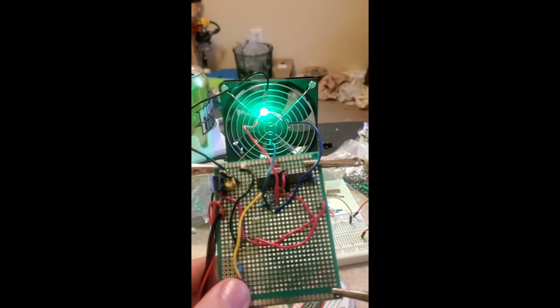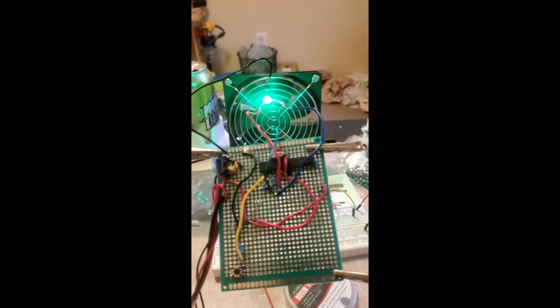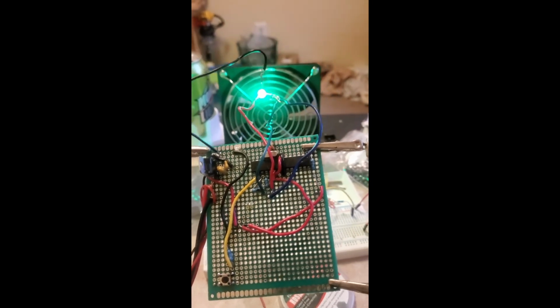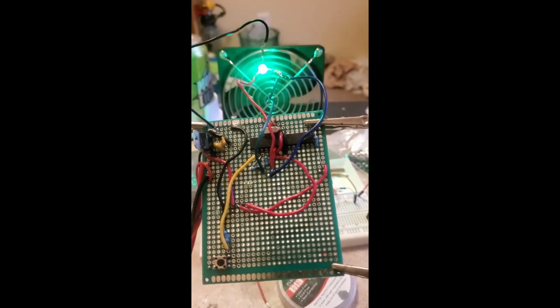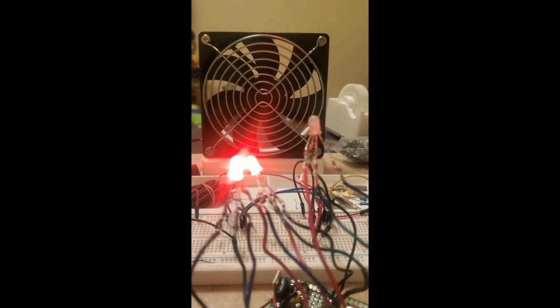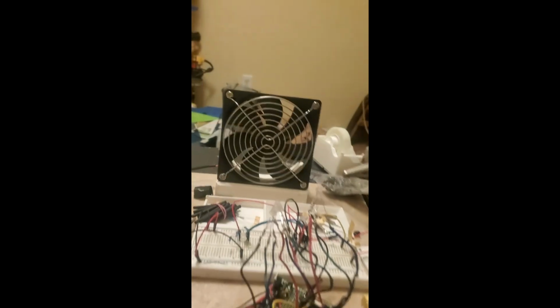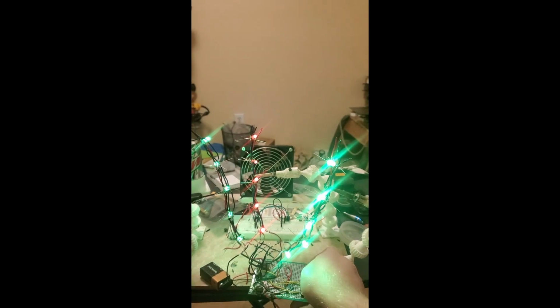So what can we add to a tube rack to make it officially over-engineered? Well, first thought that always comes to my mind is color-changing LEDs. A policy I've learned is that if you stop asking yourself, does a project need color-changing LEDs, and start asking yourself, can a project have color-changing LEDs, you start getting yes as an answer a lot more. However, in this case, it is practical. We're going to be using these to have a red, yellow, green, go, no-go rows for each of our tubes.